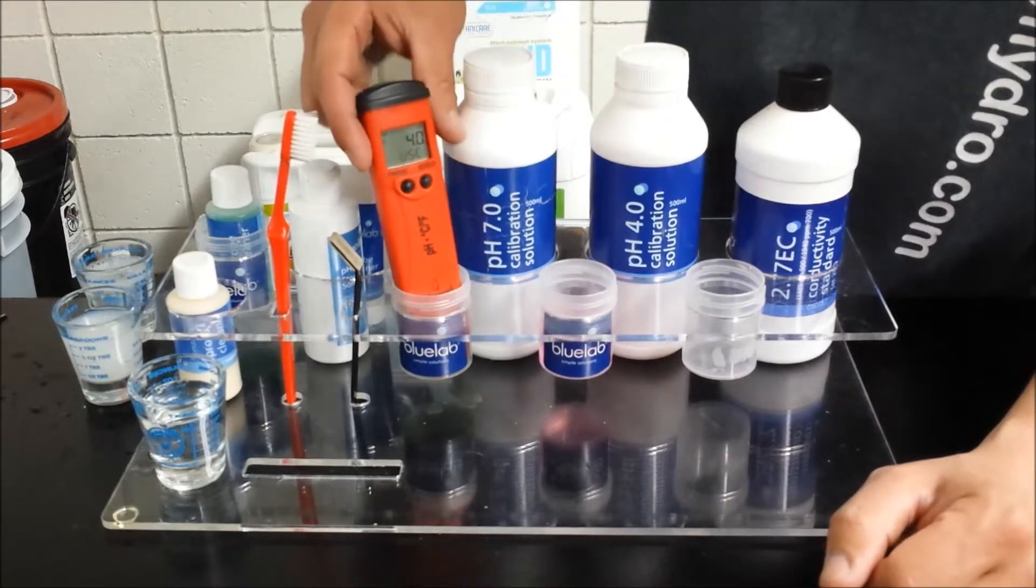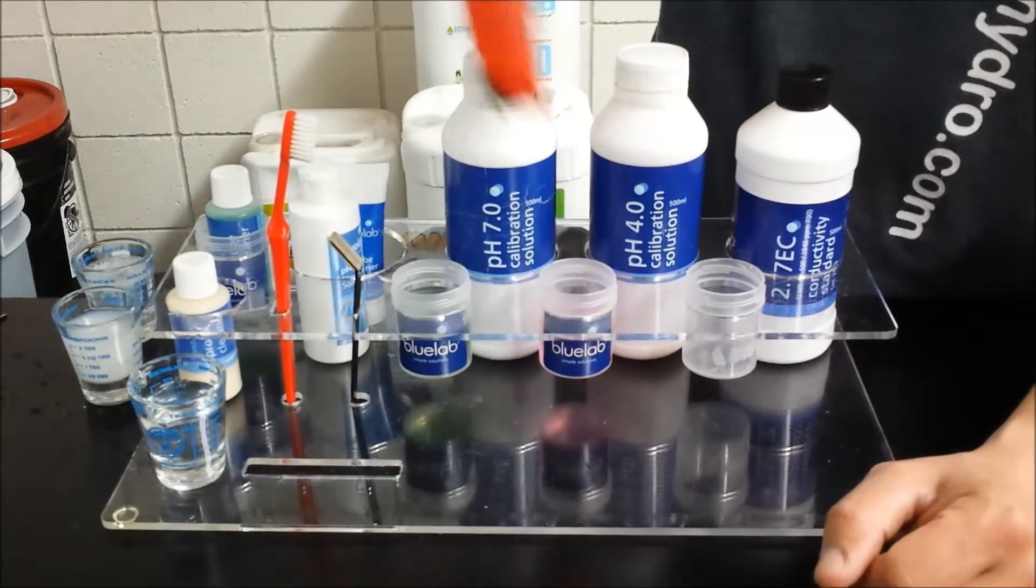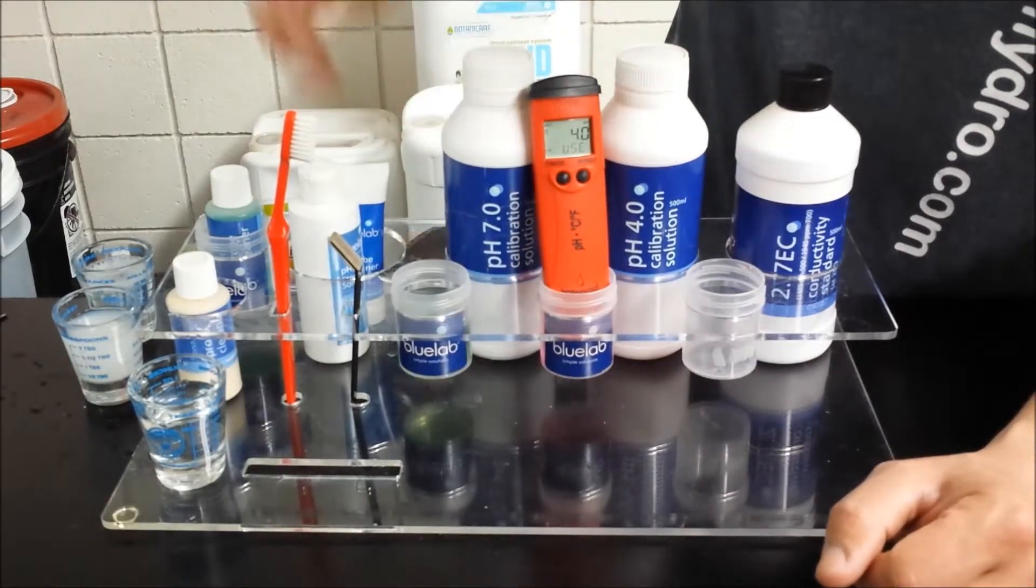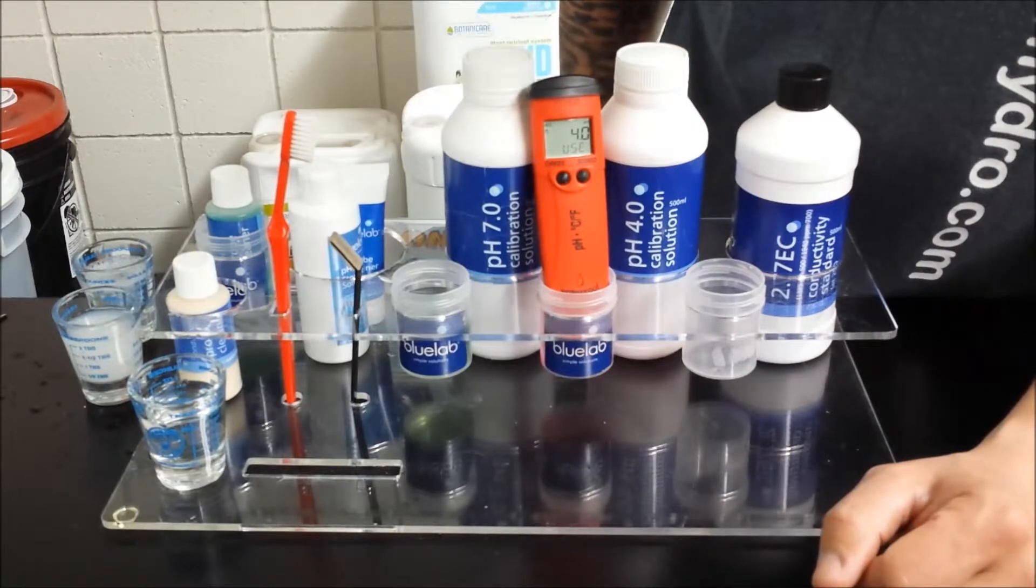Now it says use 4.0, quickly shake off the 7, rinse it in water, put it in the 4.0. It should then say record or REC 4.0.